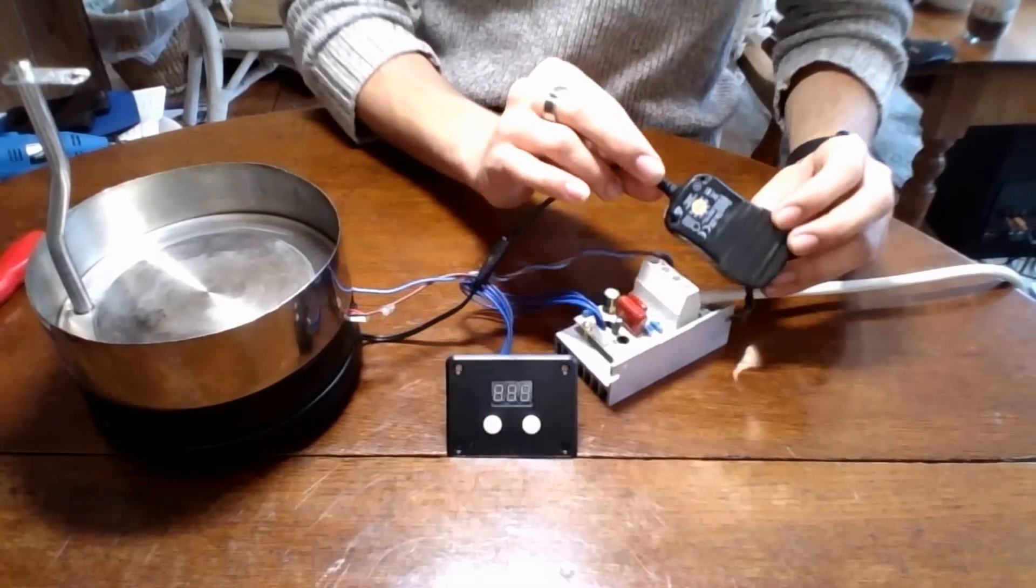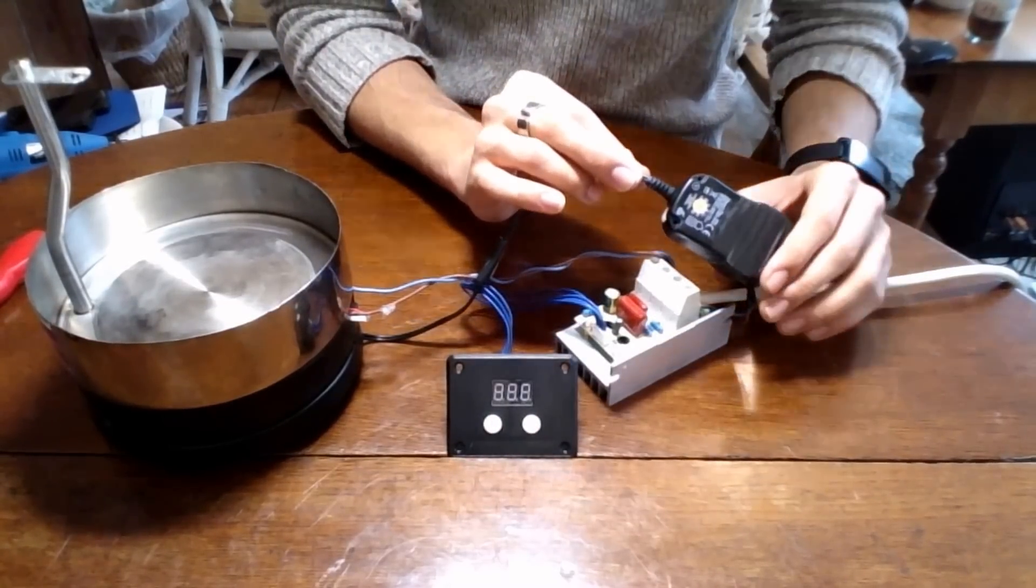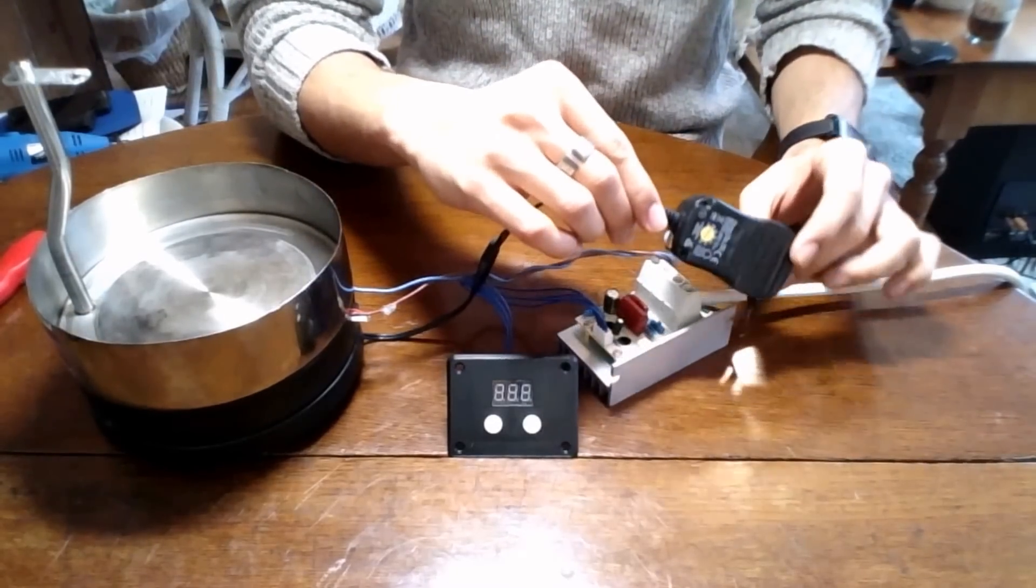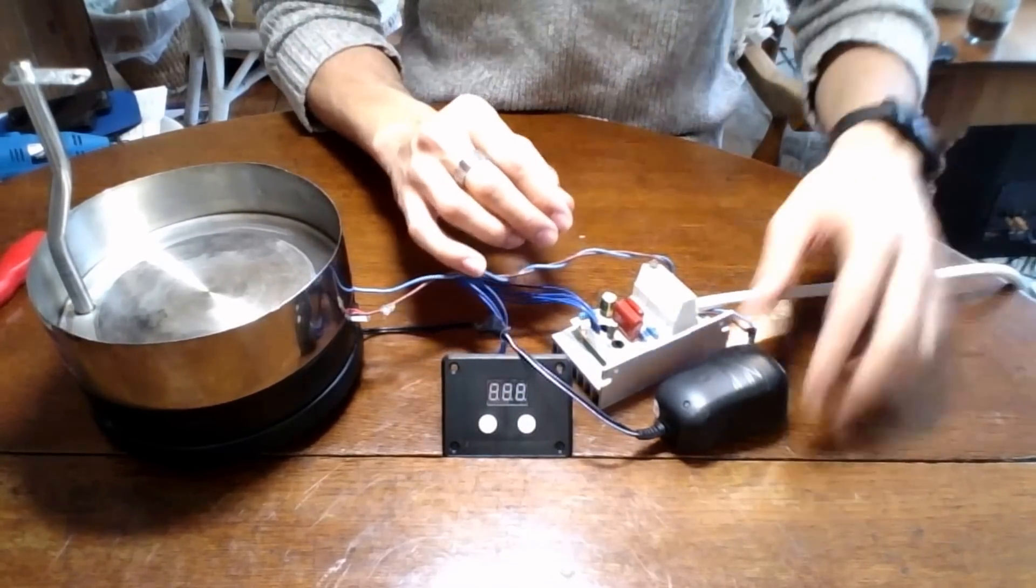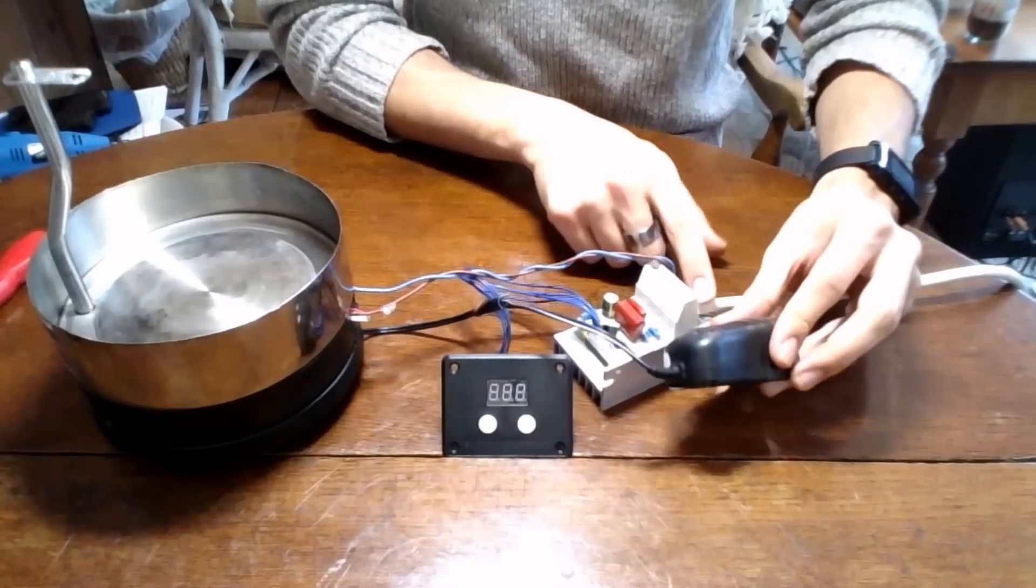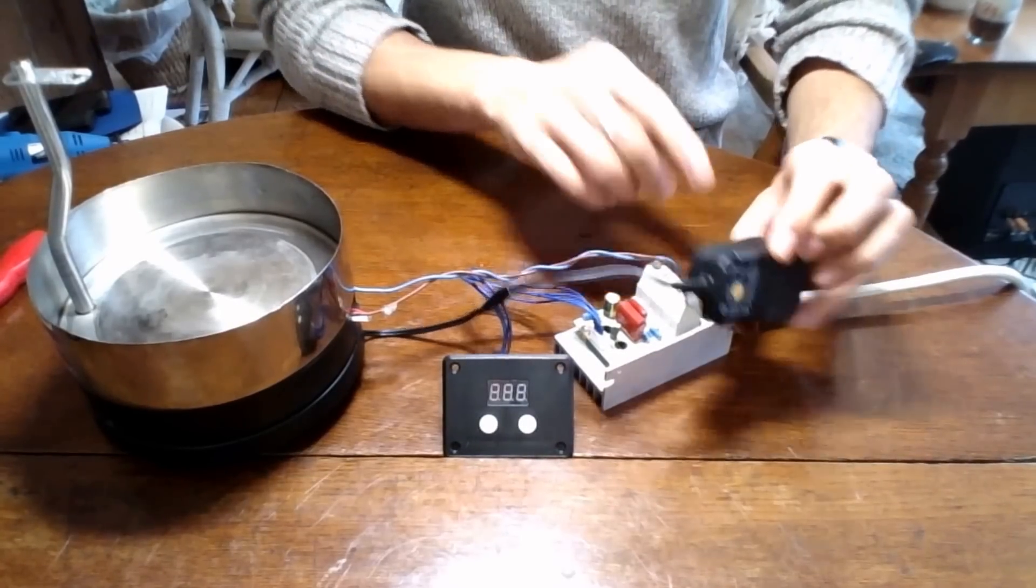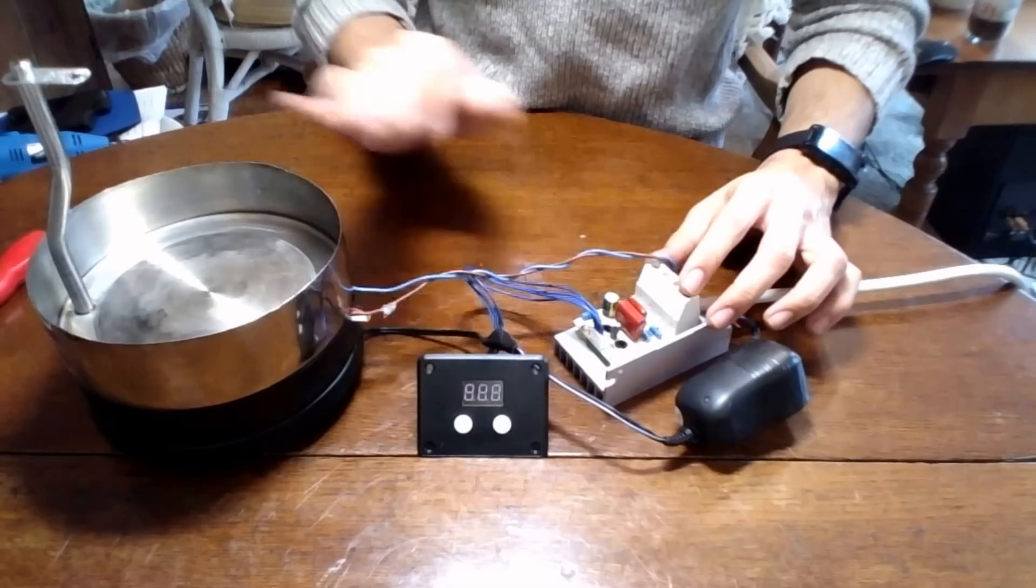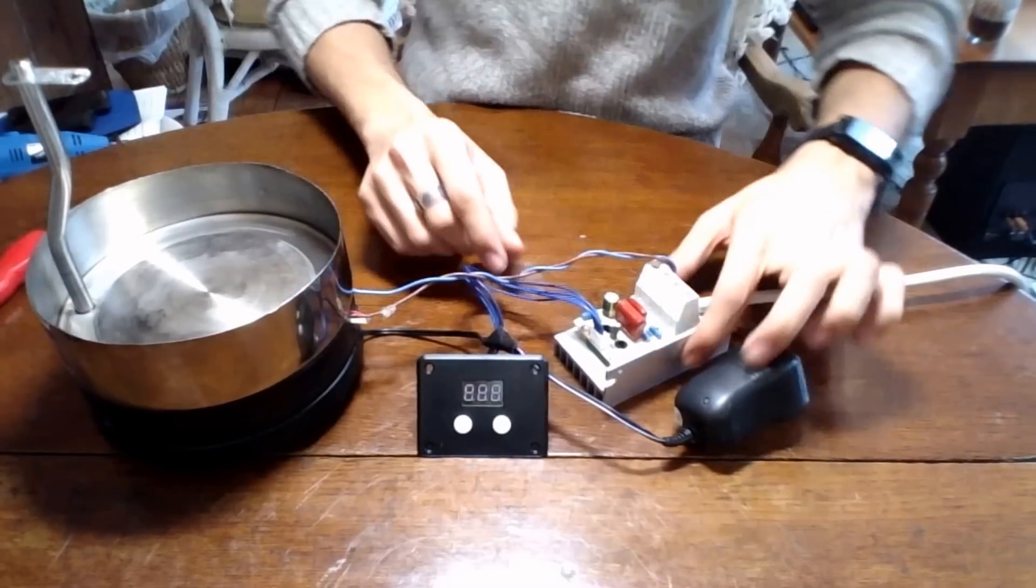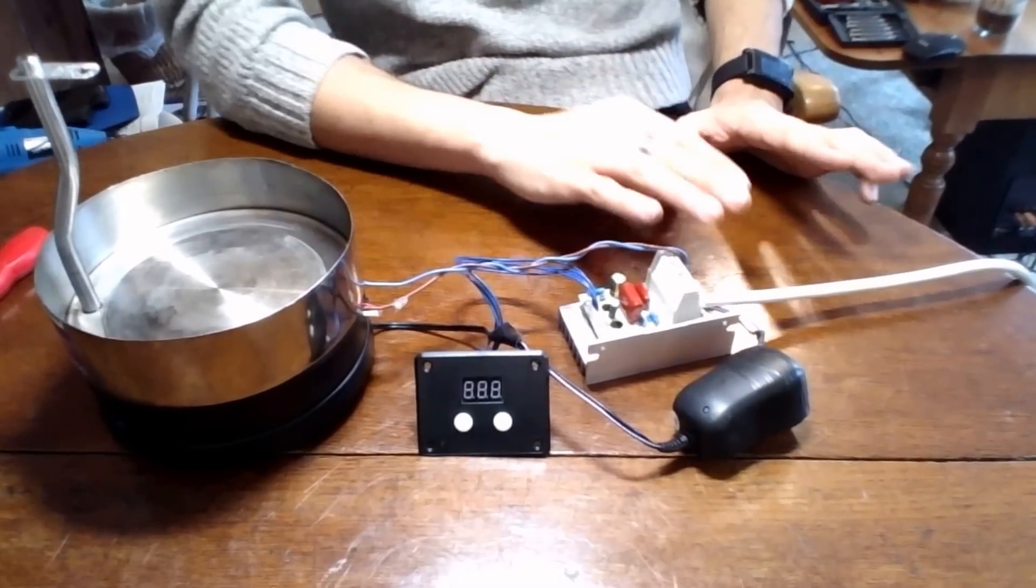Here I've got a variable voltage adapter, which powers my fan and allows me to control the speed that my fan spins at. And here I've got my main power lead. This is coming directly off the main power lead, and that's because I don't want my element control to actually control the speed of my fan as well.